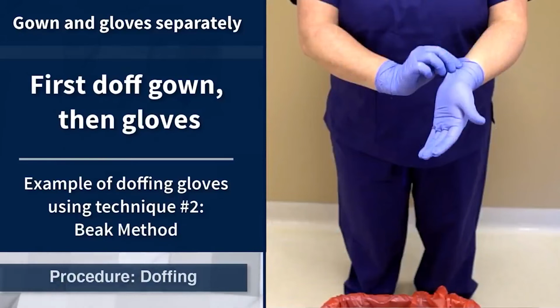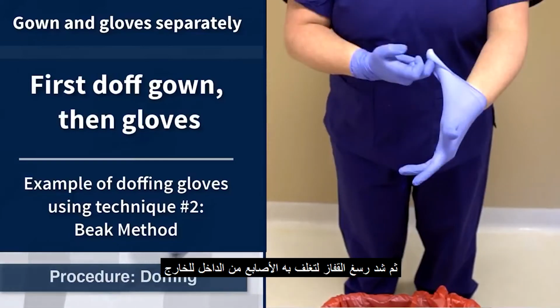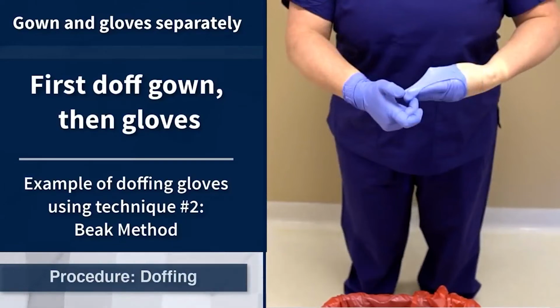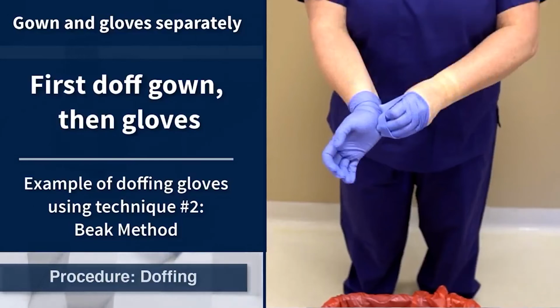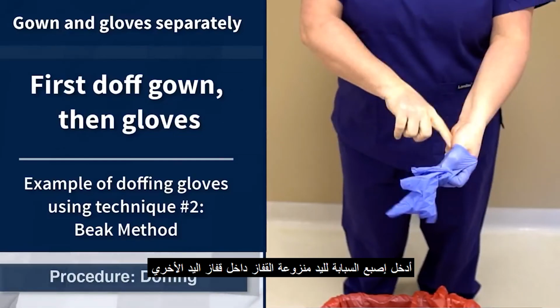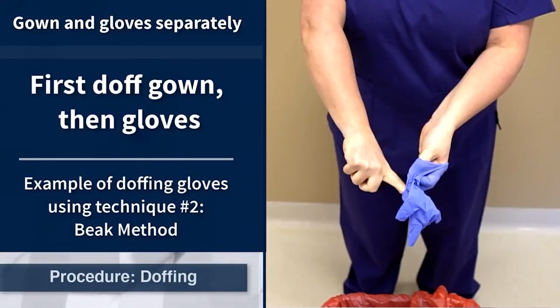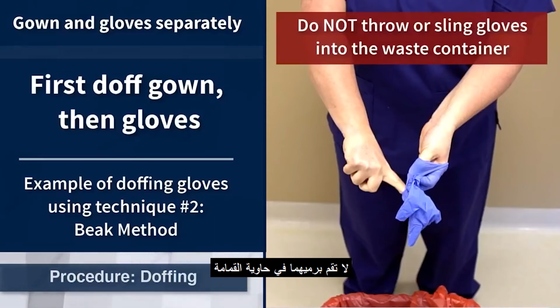Another method of glove removal is the beak method. Begin by pinching and pulling the wrist of one glove with a gloved hand, then, using a middle finger, scoop the cuff to pull the glove inside out and over the fingers and thumb to create a beak. Use the beaked hand to pinch the wrist of the other glove, pull it down and off. Slide the index finger of the ungloved hand into the inside of the glove and slide it off. After the gloves are removed, dispose of them safely. Do not throw or sling gloves into the trash.